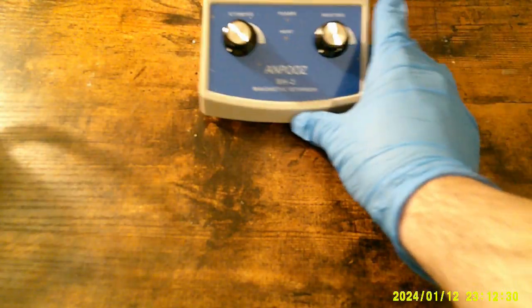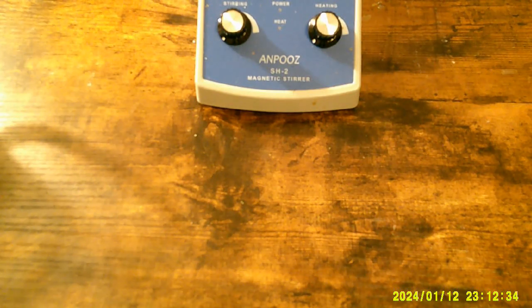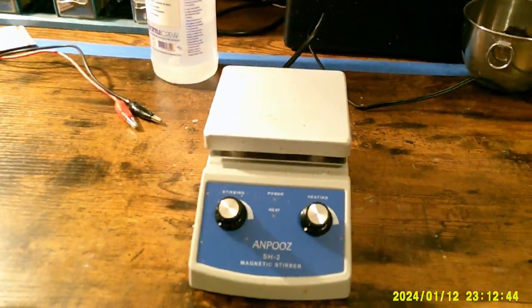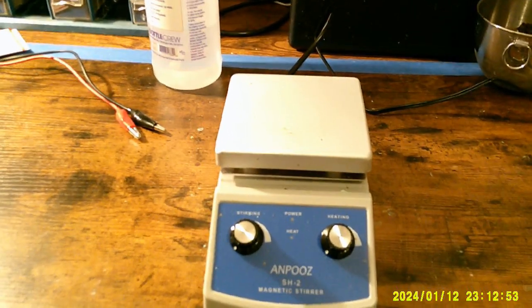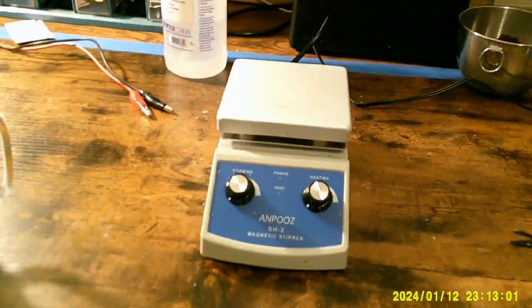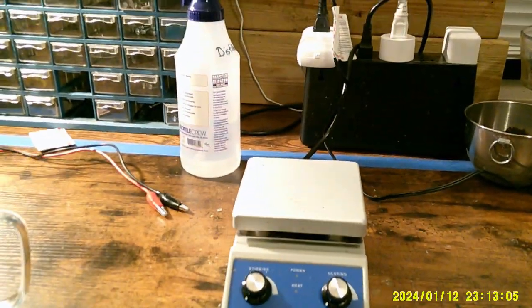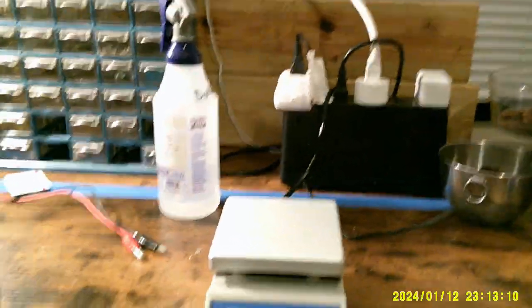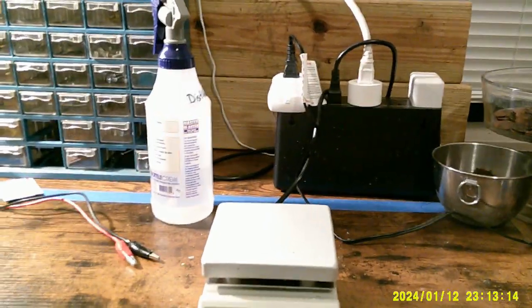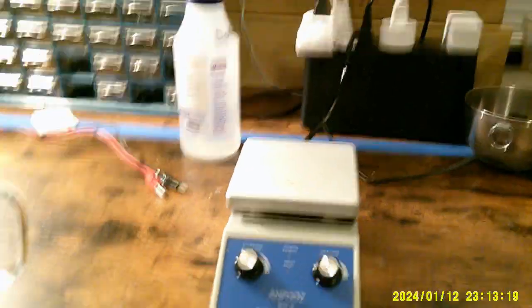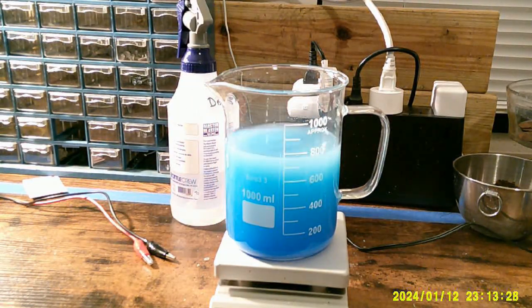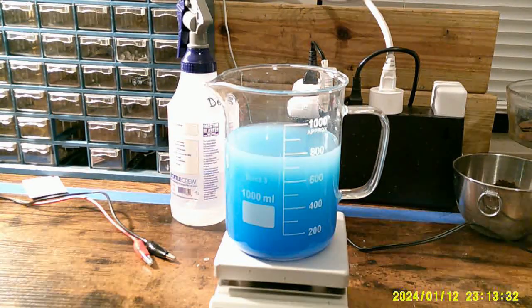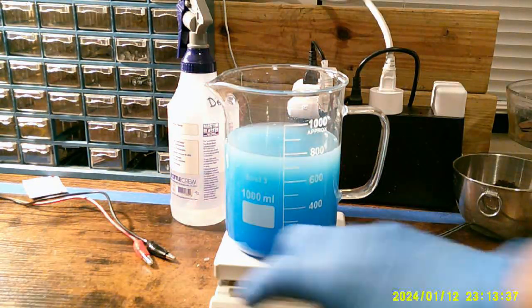In the process of trying to troubleshoot why I was and still continue to get gray goo in my copper sulfate solution, I do have an answer by the way, it's coming in a subsequent video. I purchased an actual piece of technology. That is a magnetic stirrer. And I am going to use it instead of myself to stir this thing. Eventually I will get good enough with this whole setup. I don't spend a lot of time doing this kind of prep work. For this, put the copper sulfate solution, or will be a solution in there. I drop one magnetic stirring rod in and I turn it on.